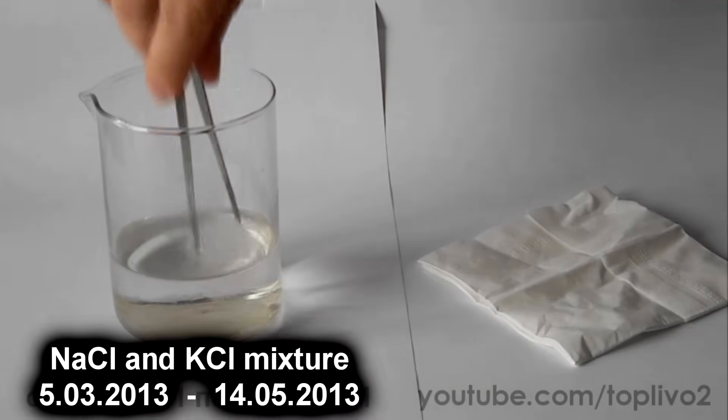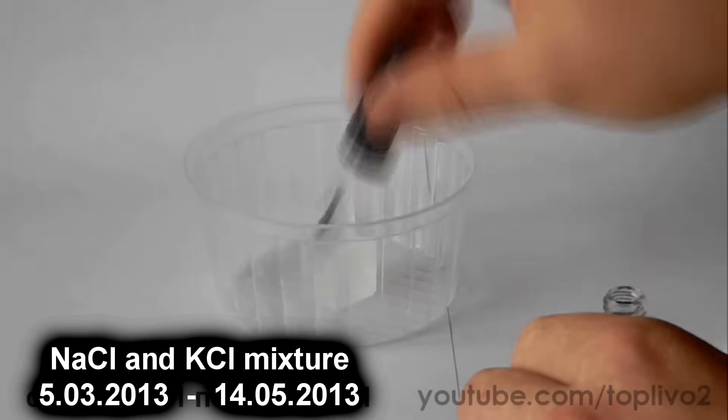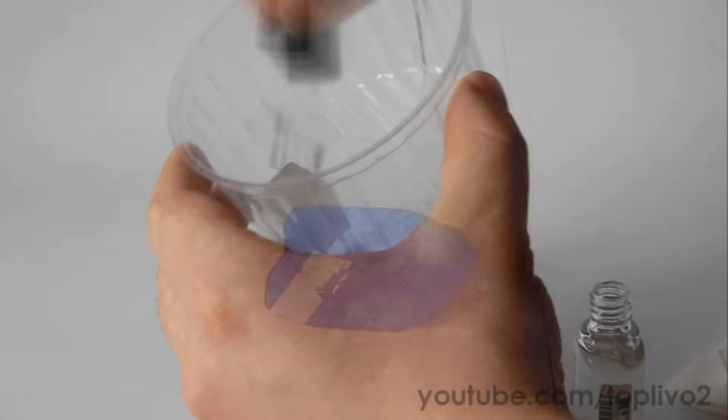My second crystal, a mixture of sodium chloride and potassium chloride, has grown a lot. I am covering its surface with lacquer. After the lacquer has dried, the crystal can be touched with bare hands.